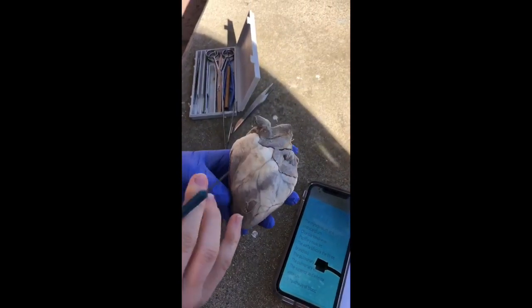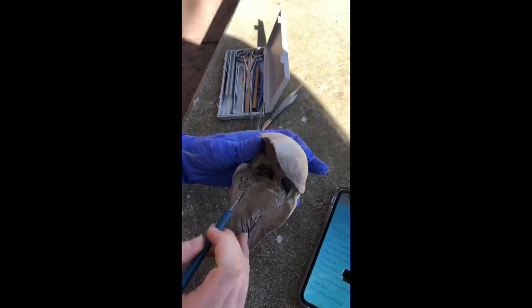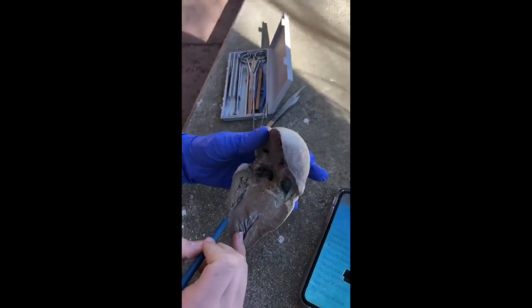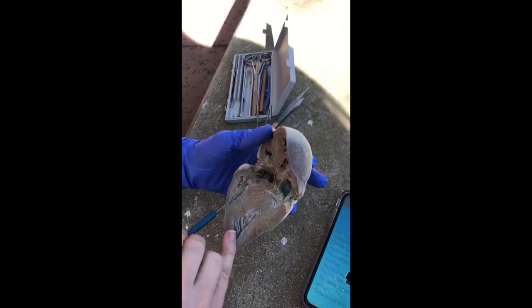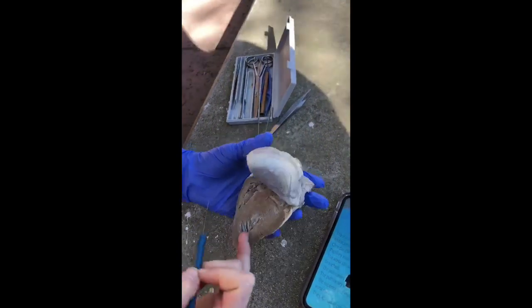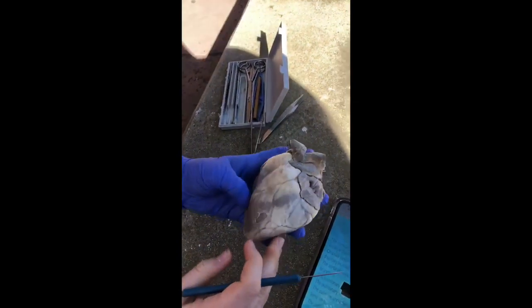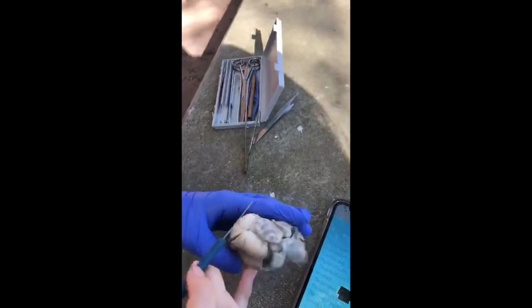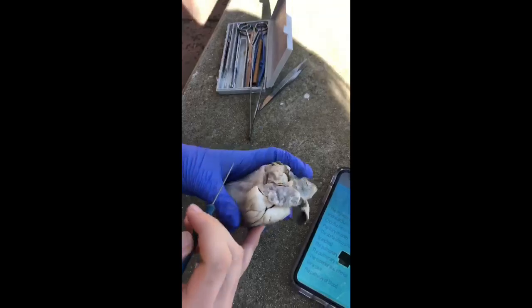That's it. So from the right atrium, we go inside to the tricuspid valve, which is going to be this side, and then also through to the right ventricle, which is going to be lower because the atrium is higher up. From the right ventricle, we have the pulmonary semilunar valve, which then goes to the pulmonary arteries, which are relatively going to be up here. From there, the pulmonary arteries go through to the lungs, and from the lungs it comes back through the pulmonary veins.